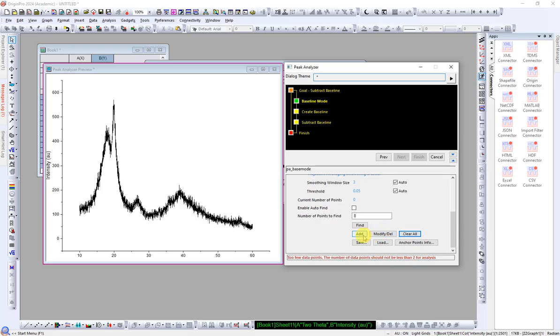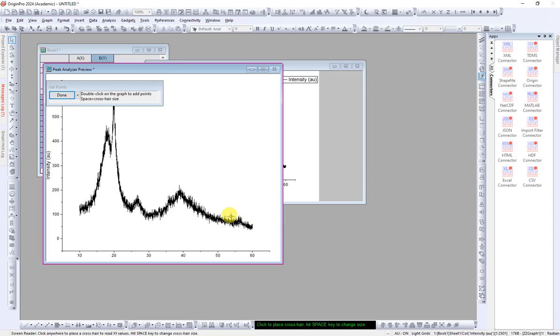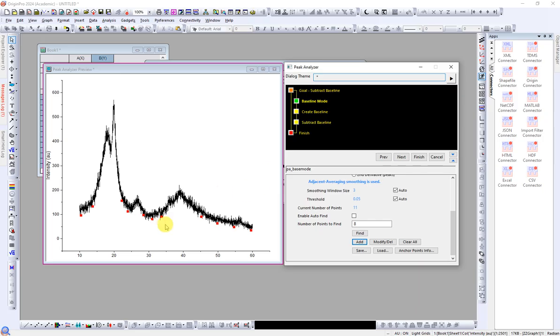So just click on Add. Make sure you have unchecked the auto find. The number of points, just forget about it, it was for auto. So we will add as many as we want. The first point we will add here, then maybe here, sorry, double click. First point here, second maybe here, third here, fourth here, double click, fifth here, sixth here, seventh here, eighth here, ninth here, tenth here, eleventh here. You can add multiple points by just double clicking, and then click on Done. Okay, we have already added them.